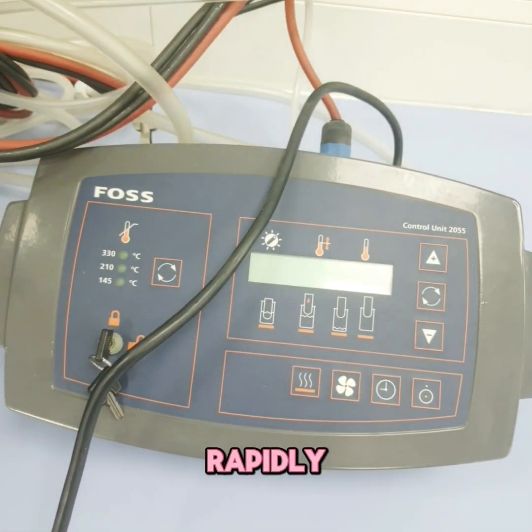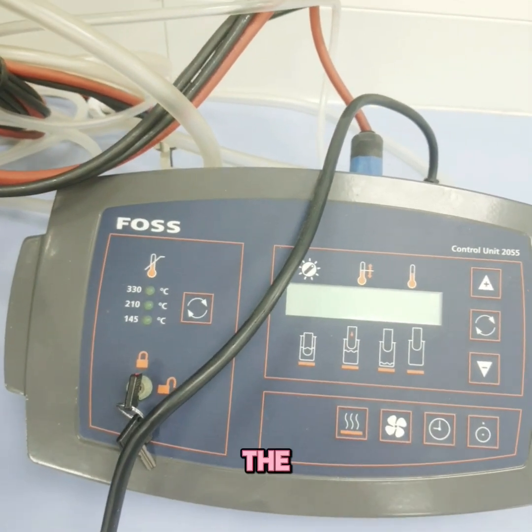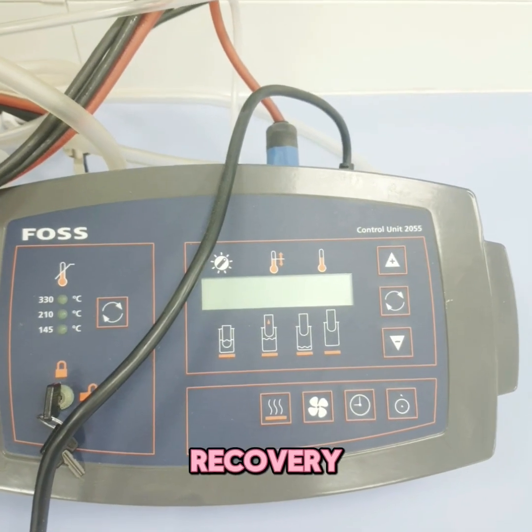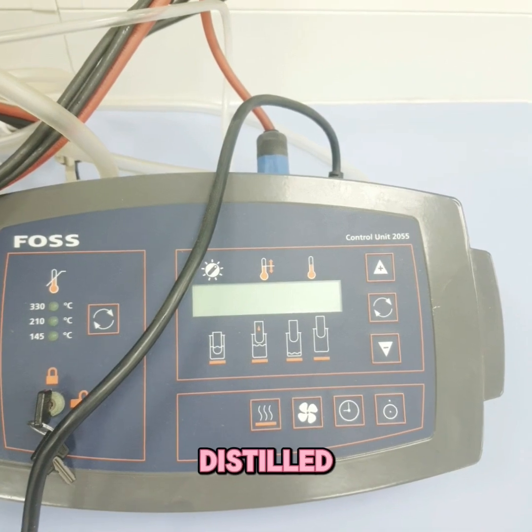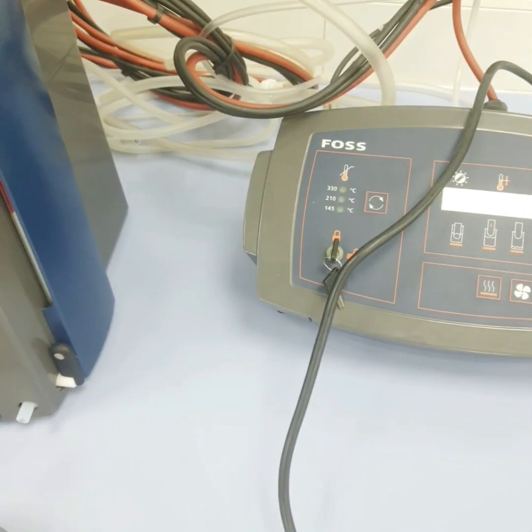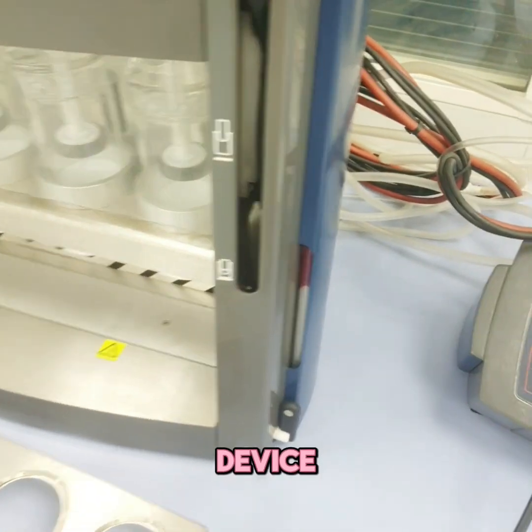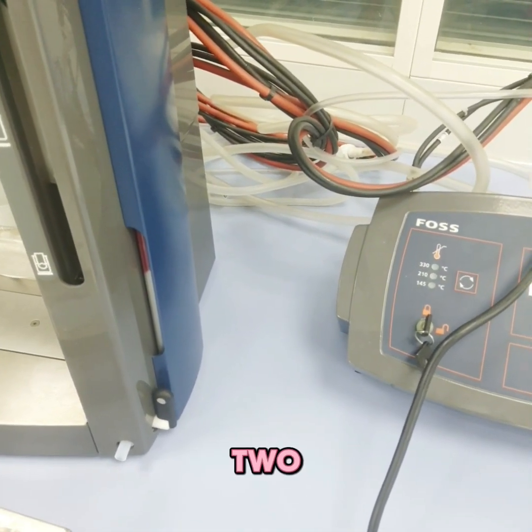In the boiling step, the sample is rapidly solubilized in boiling solvent — you need to know the boiling point of the solvent being used. In the rinsing step, remaining soluble matter is removed. In the recovery step, distilled solvent is automatically collected and can be reused. For fat in food, you just run the device for one to two hours.